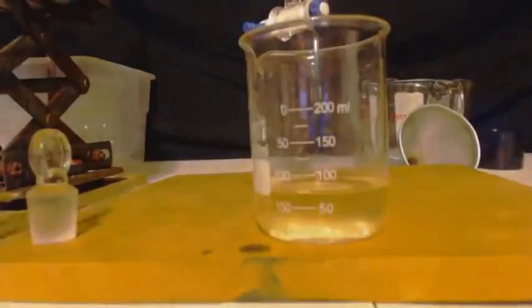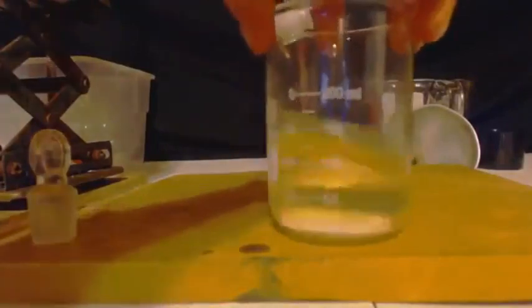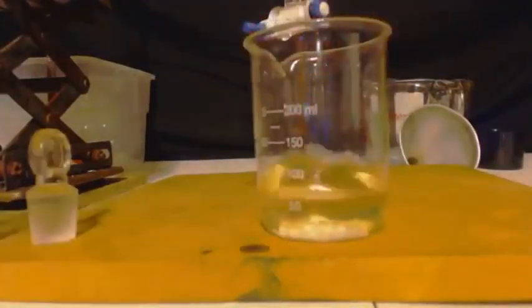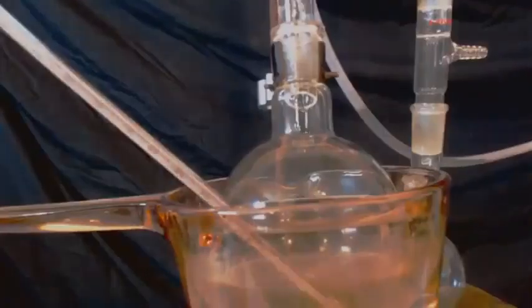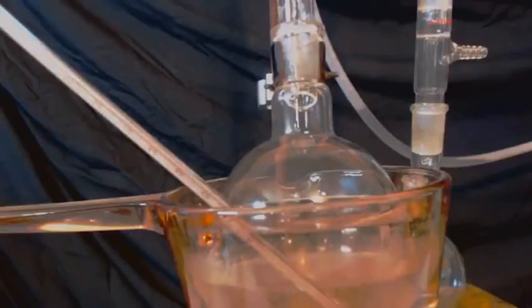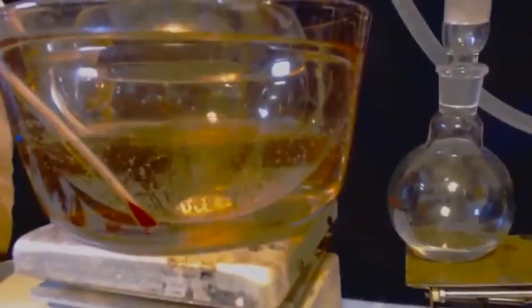Now, this is where the things change. What I did last time was I just basically dried it out and it'll clear it up nice and crystal clear, and I just fractionally distilled it and boiled out everything at 110 to 112 degrees, and I only got 5 milliliters, so that wasn't such a great idea. This time I'm going to do the azeotropic distillation. I got 75 milliliters of hydrocarbon.